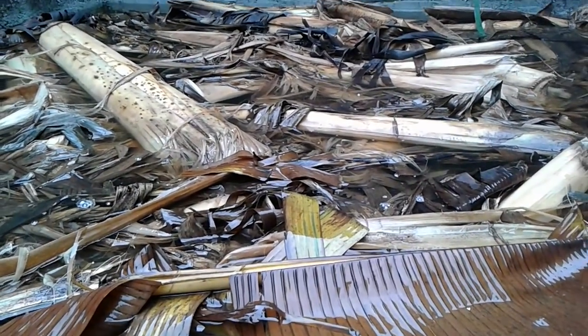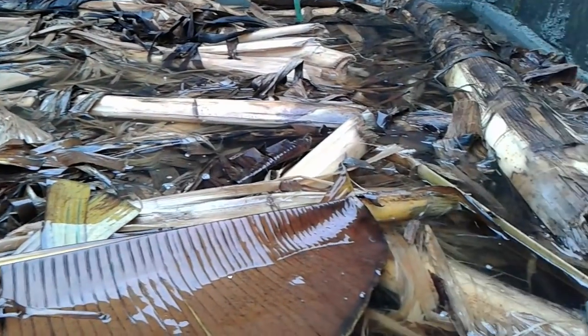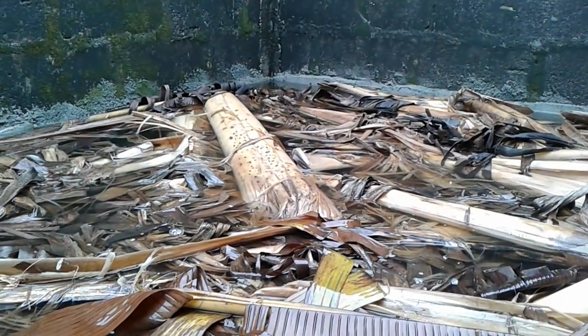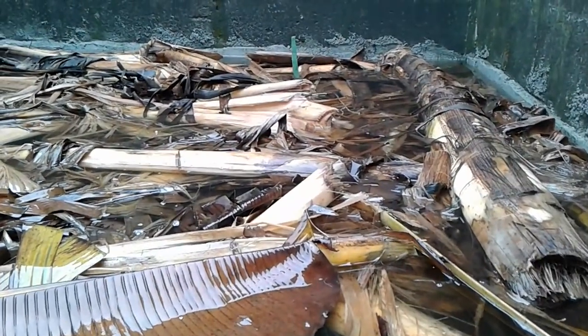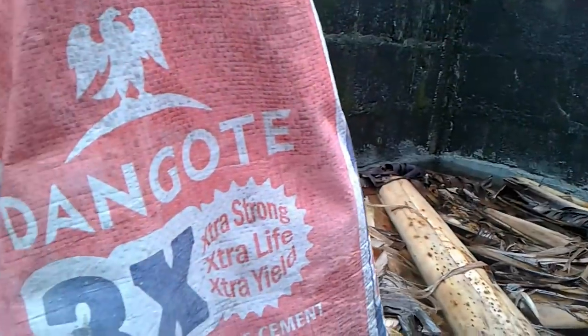The plantain leaves have changed the nature of the water drastically, which means you can use these to reduce the acidity and correct your water pH. Let's go take some samples — I want to take samples from my farm, then immediately move to my office. Also, some of you might think that cement is acidic; we are actually going to find out what the pH of cement is.